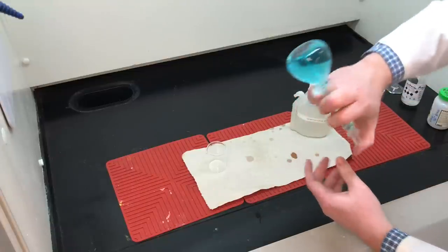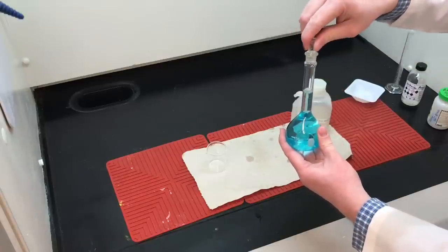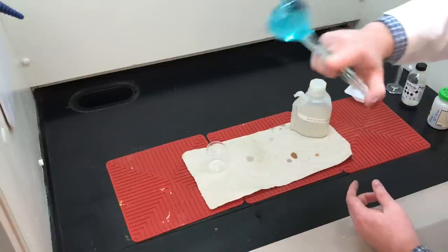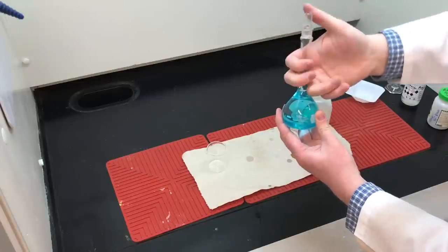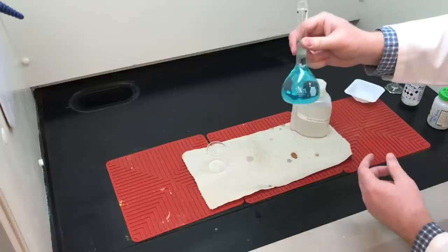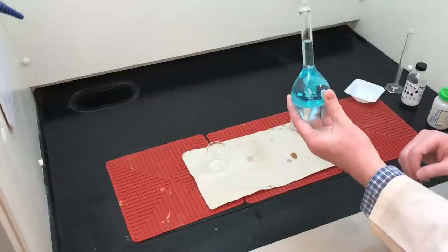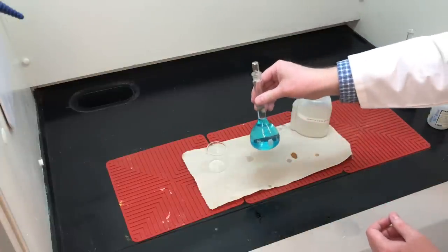I'll take the stopper of the flask, stopper it securely, turn it upside down and mix — I'll do that three times. This 100 milliliter volumetric flask now has all of our brass dissolved and diluted in it. The solution is slightly acidic because of the excess nitric acid, but it's now quite diluted, so it's pretty safe to handle. We're going to measure its absorbance later along with some standard solutions of copper.